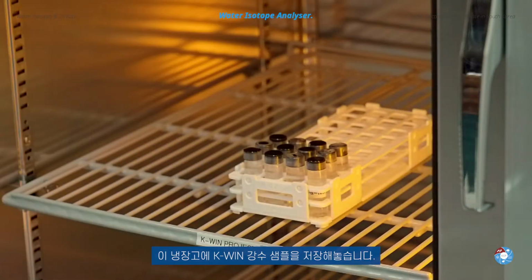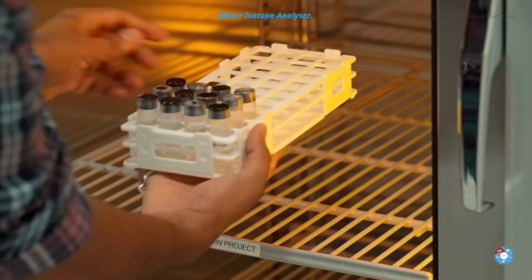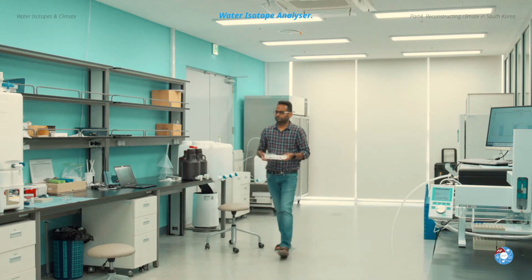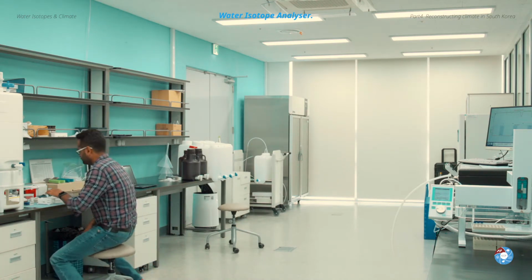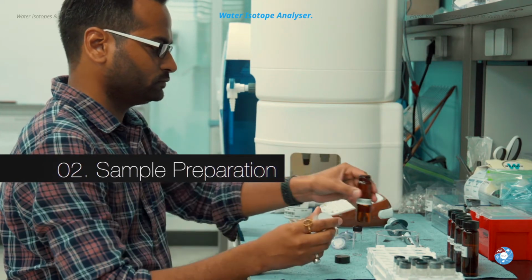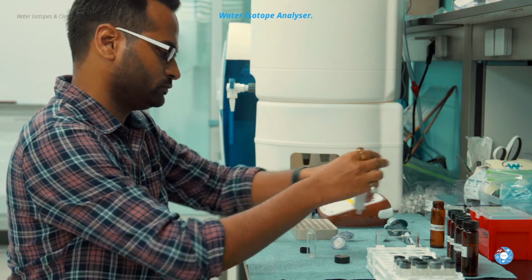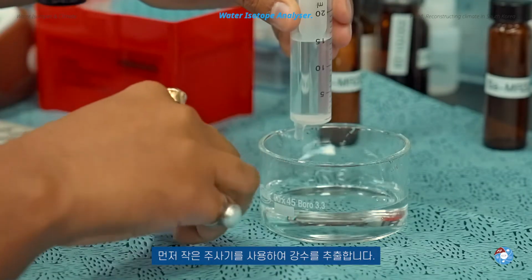In this fridge, we store the KWIN water samples. We extract the water using a small syringe.